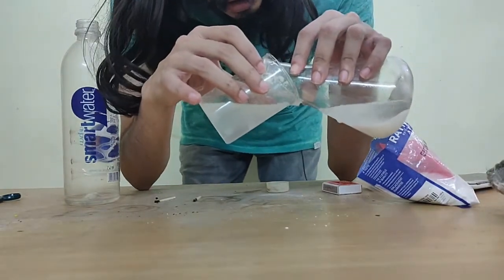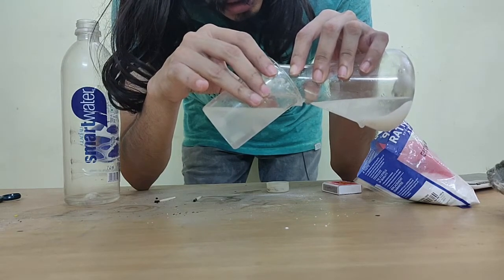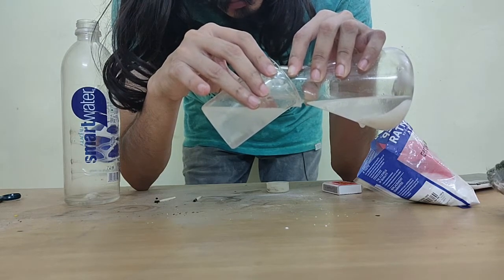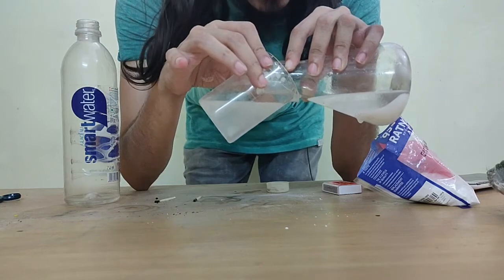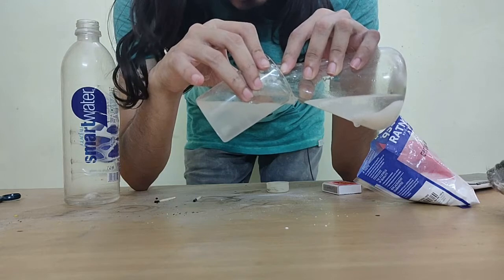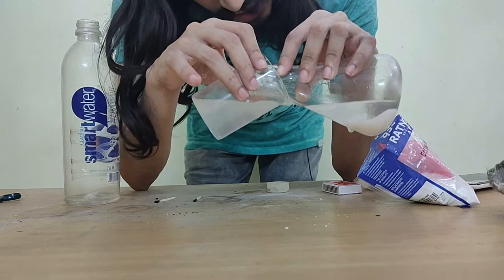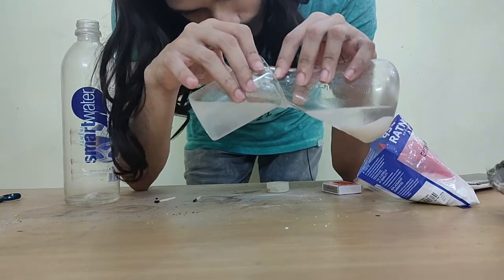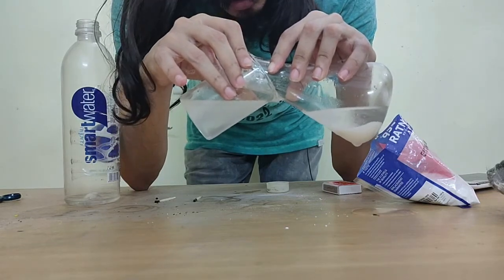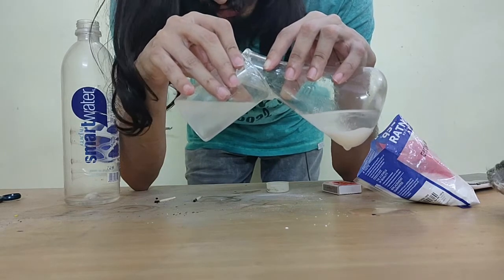Just keep noticing the color of the liquid in this small beaker. You'll see it starts going a little opaque. That's what we should be able to see here, but I'm not able to see because my hand is in the way. But when it starts to go opaque, it's pretty much certain that this is carbon dioxide gas being produced. Now the reaction is brisk, it happens really quickly, so it's a little hard to tell when the reaction is going to finish.